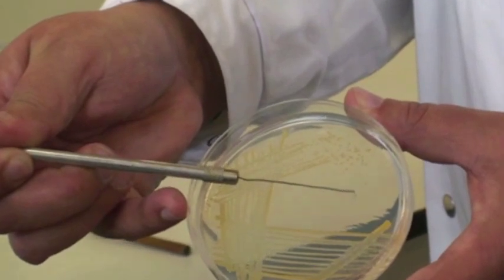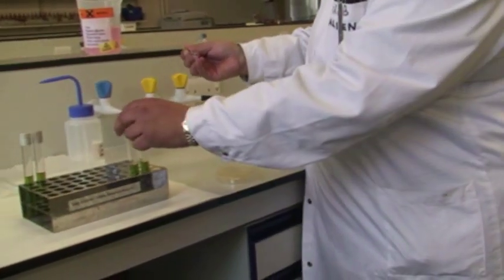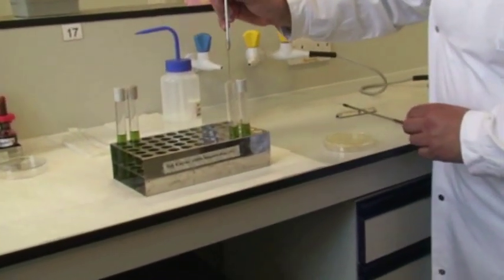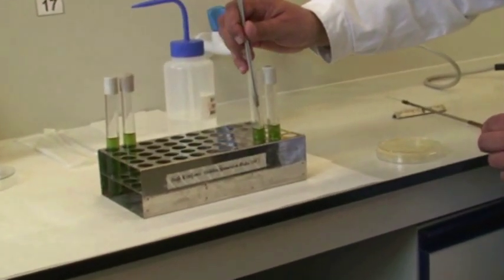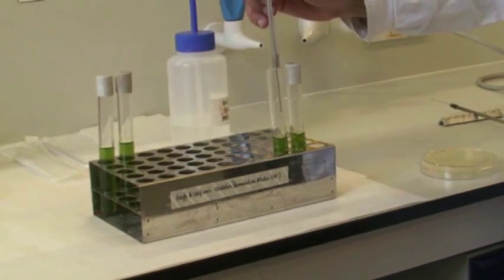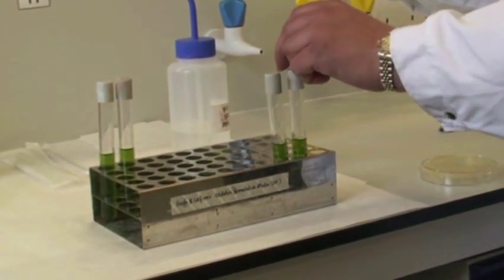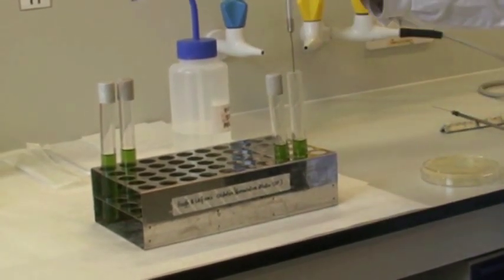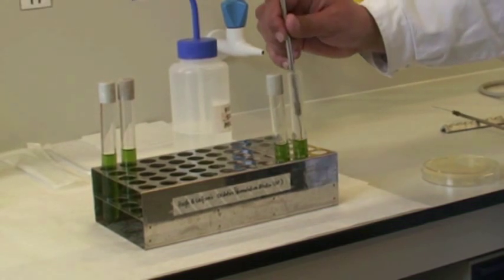Then inoculating first the first tube, going straight down, and then going to the second tube, doing exactly the same, going straight down and inoculating.